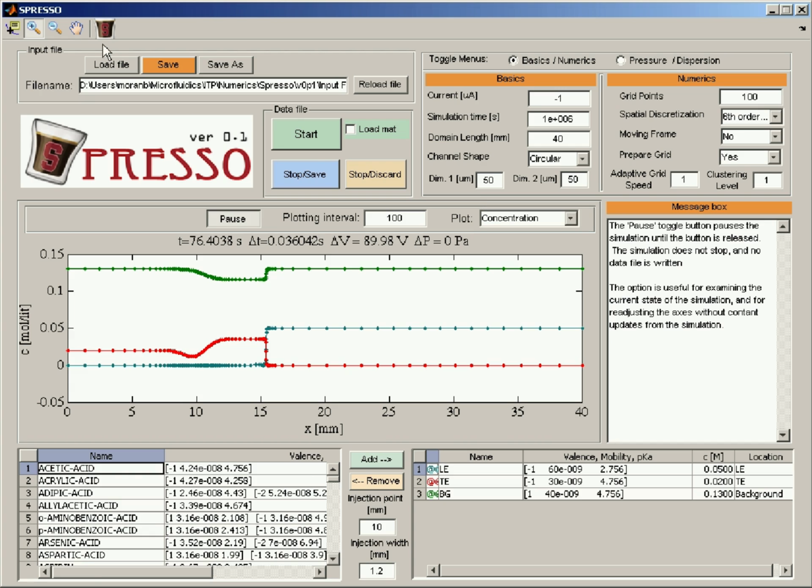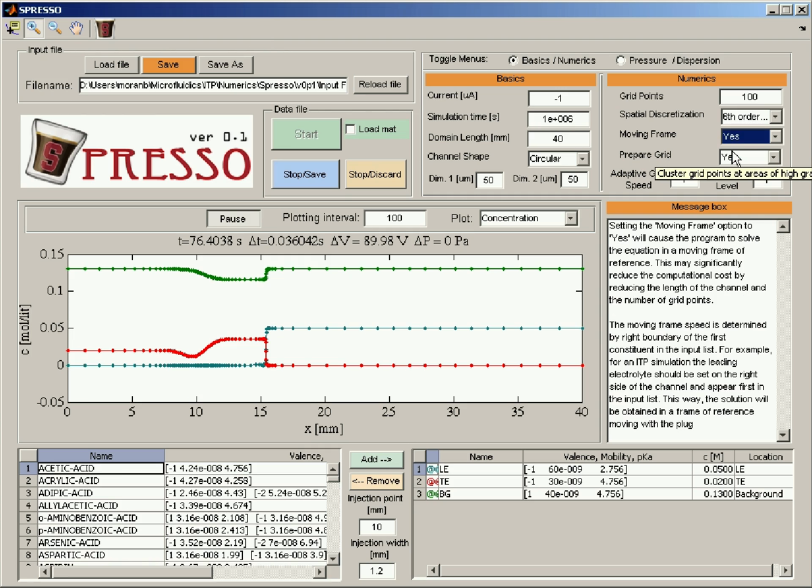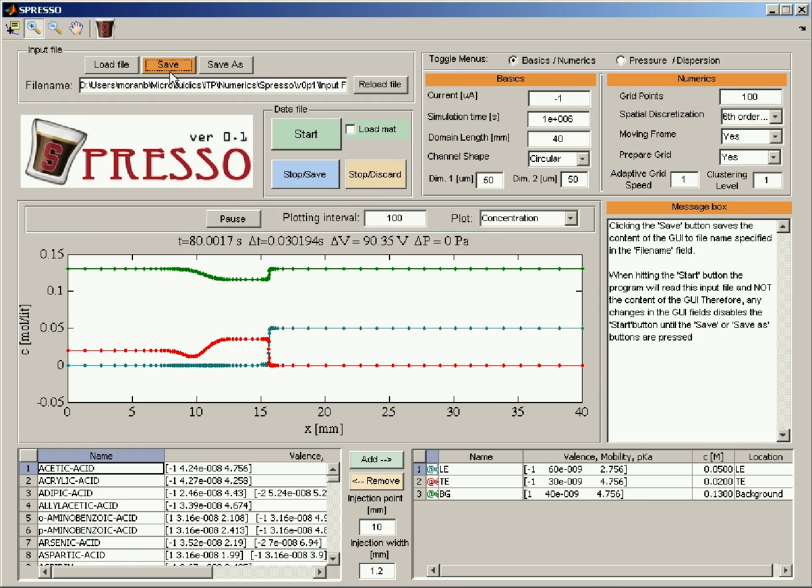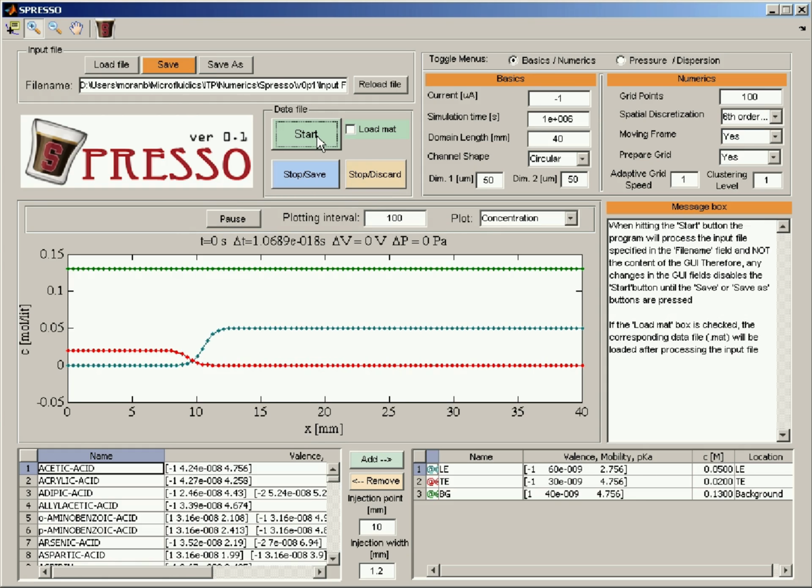So now let's look at some of the other options. We have the moving frame option, which is currently set to no. Let's set this to yes and see what it does. I'll first unpause, stop it, and then save it under this mode. And if I start this now, you'll see that the interface no longer moves downstream. Instead, it is stationary, and we are now solving the problem in a frame of reference moving with a plug.